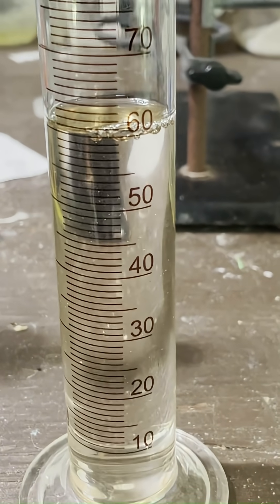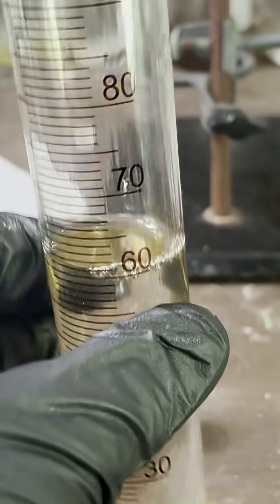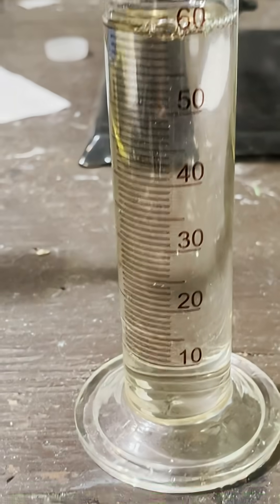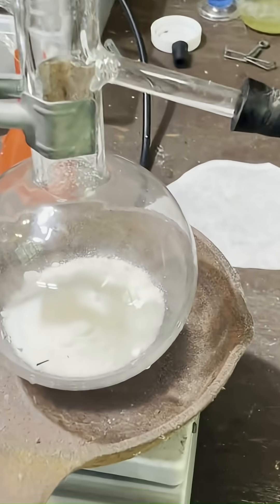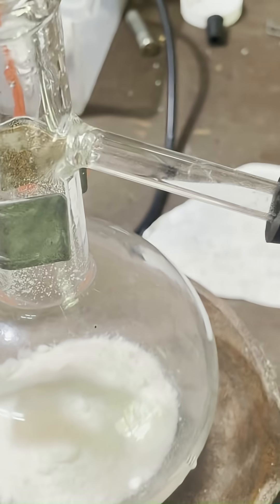There we are — 60 milliliters of the almost syrupy sulfuric acid, and now we're going to add that into our potassium nitrate.